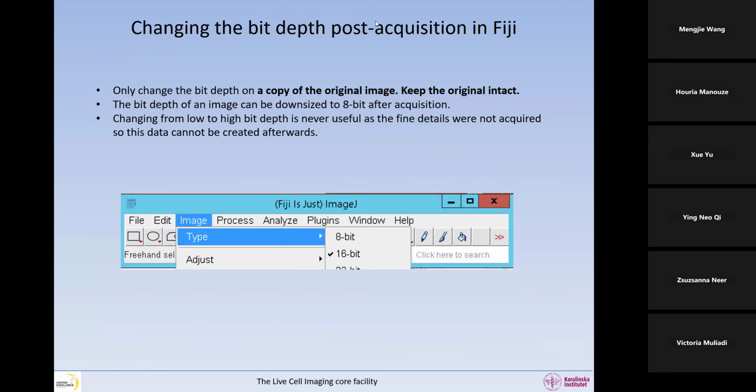So how to change the bit depth after acquiring? In Fiji, for example, you can go to Image, Type, and there you can change the bit depth, I think. This is something you have to do before you display. If you have a high bit depth image, you have to put it in 8-bit to be able to insert it in PowerPoint, for example. So only change the bit depth on a copy of the original. Keep the original intact, okay? This is very, very important. Always do not transform the original image. You can do all sorts of stuff, but work on a copy. If you change the display, it's fine because you can reset it. But once you've gone down to 8 bits, you cannot go back to 16, where you can, but you've lost the information.